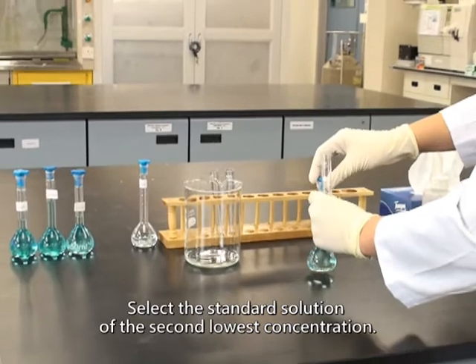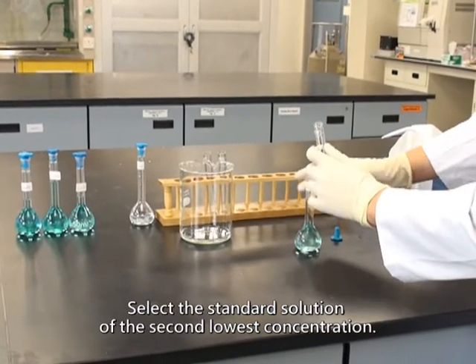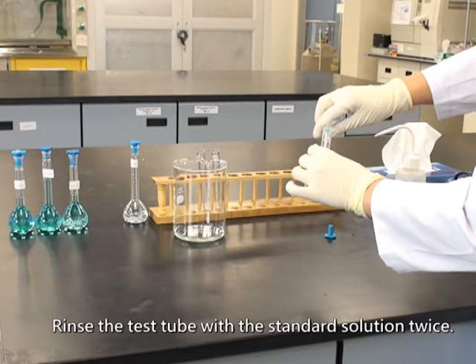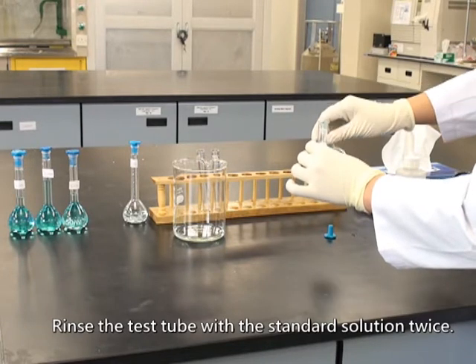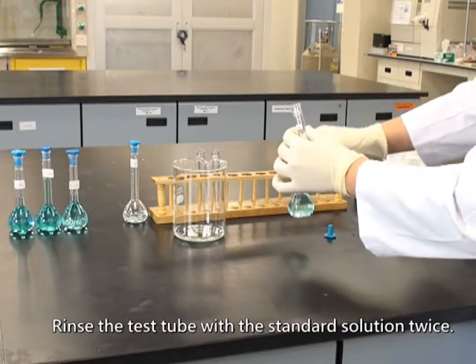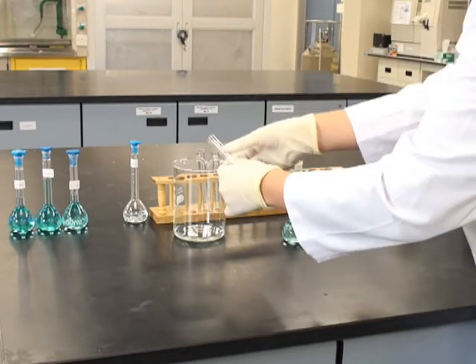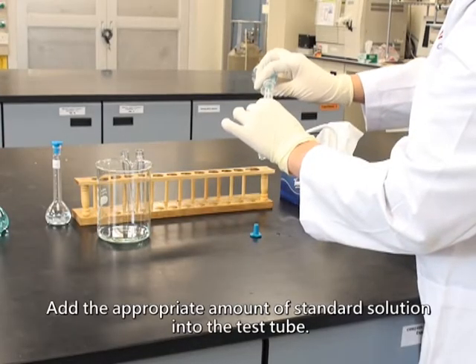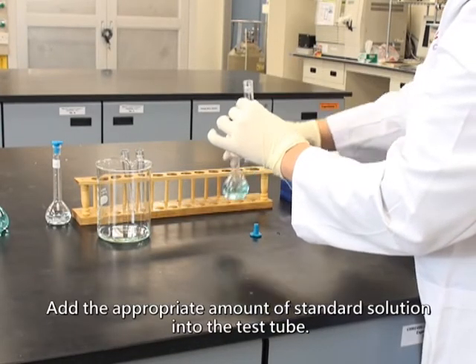Select the standard solution of the second lowest concentration. Rinse the test tube with the standard solution twice. Add the appropriate amount of standard solution into the test tube.